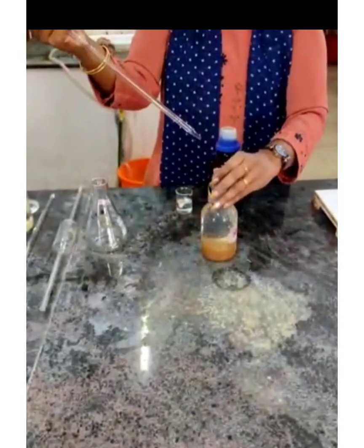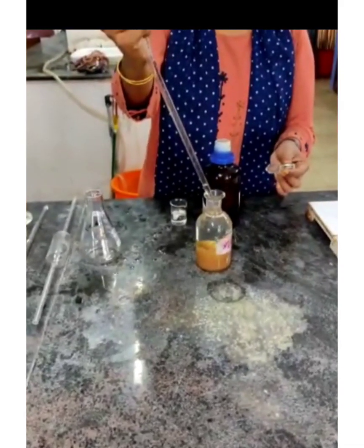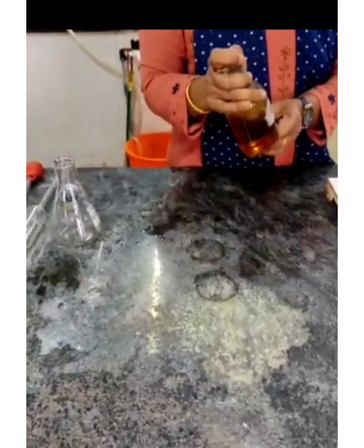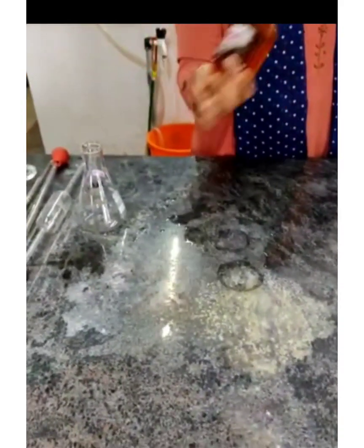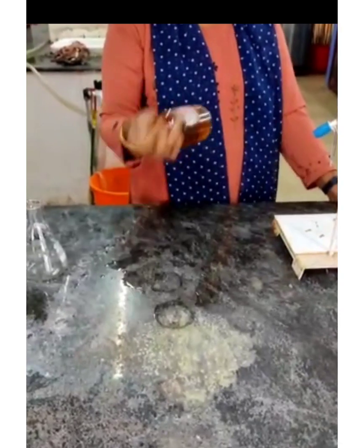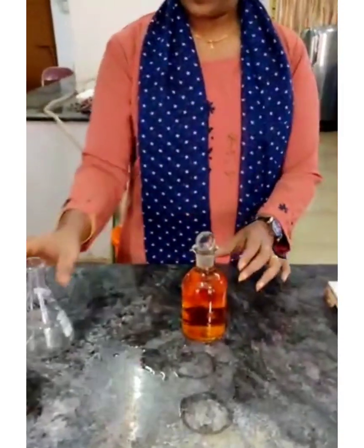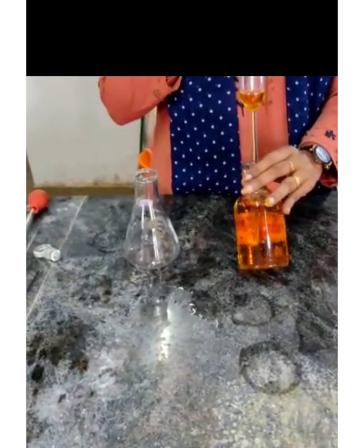Add 2 ml concentrated sulphuric acid, then insert the stopper and shake well. From this bottle, 203 ml of solution is taken out.